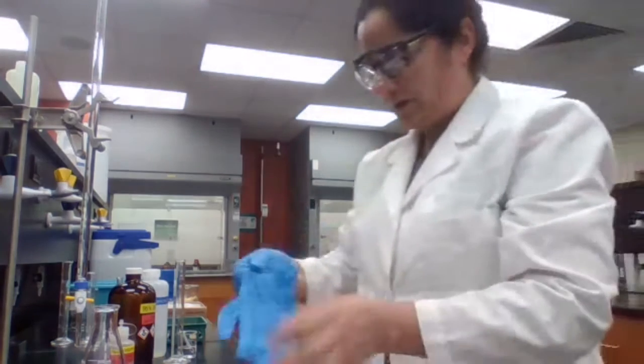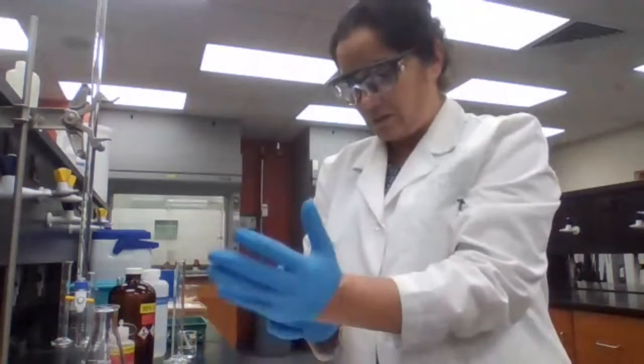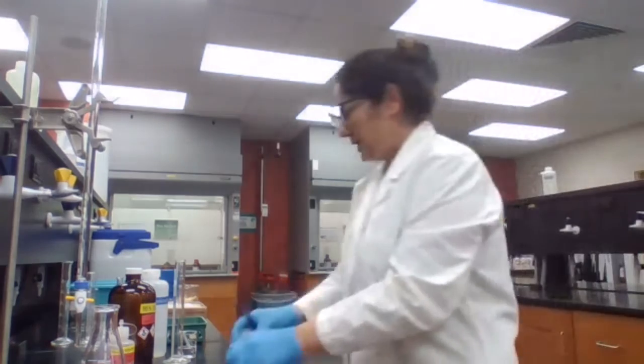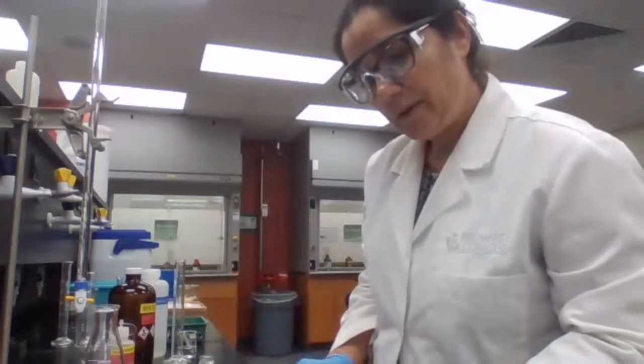Okay, for those of you working with unknown B, what should be the first test you think I should do? Dinitrophenylhydrazine? Okay. Let's try the dinitrophenylhydrazine, DNP.